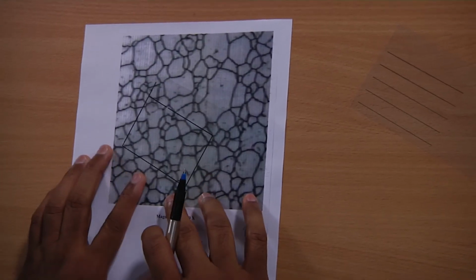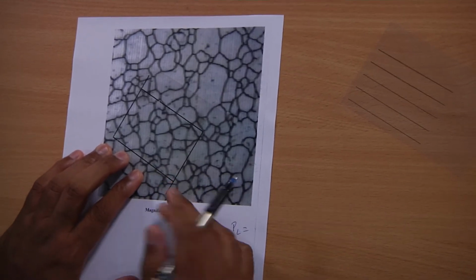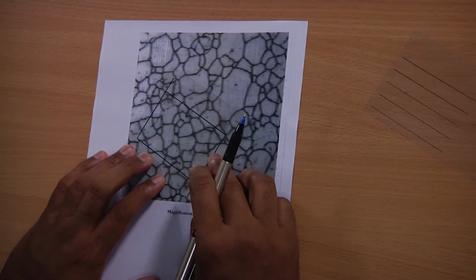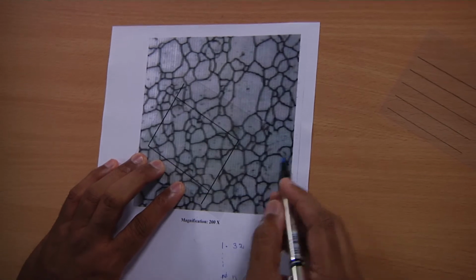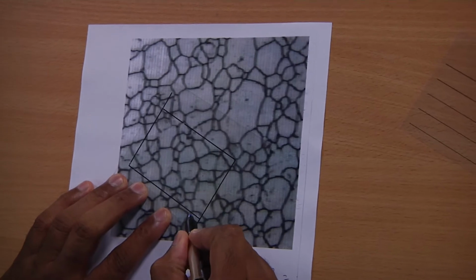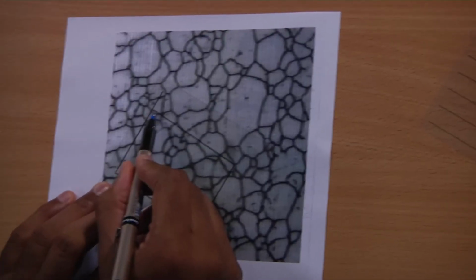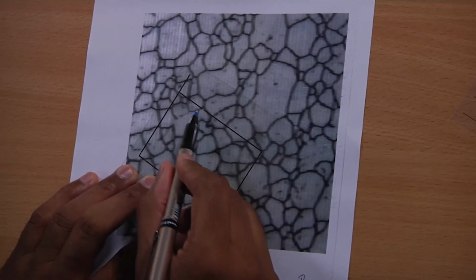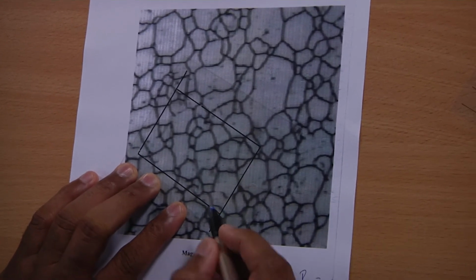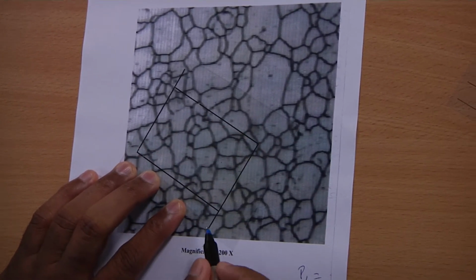So, we can place this probe at an arbitrary orientation. What is the rule of using this kind of probe? This is an unbiased probe, and the unbiased way of counting is you have to eliminate the grains intersected by these two lines, and include the grains intersected by this line and this line. So, that is the unbiased counting. You exclude these lines and include those lines. So, let us do that counting.